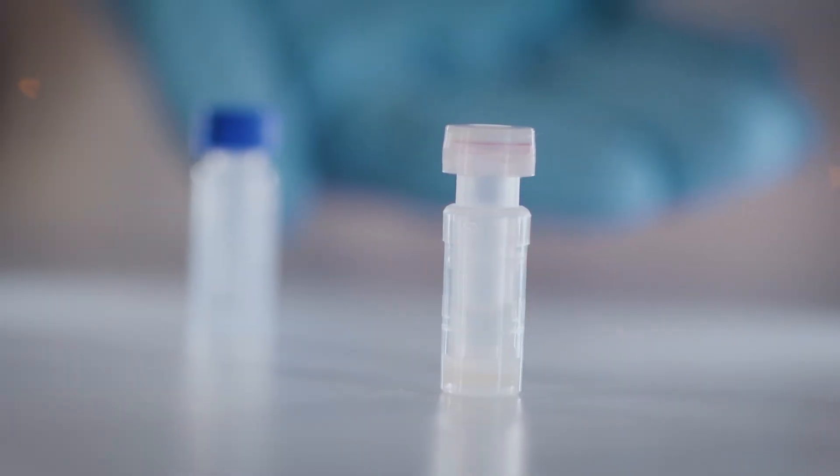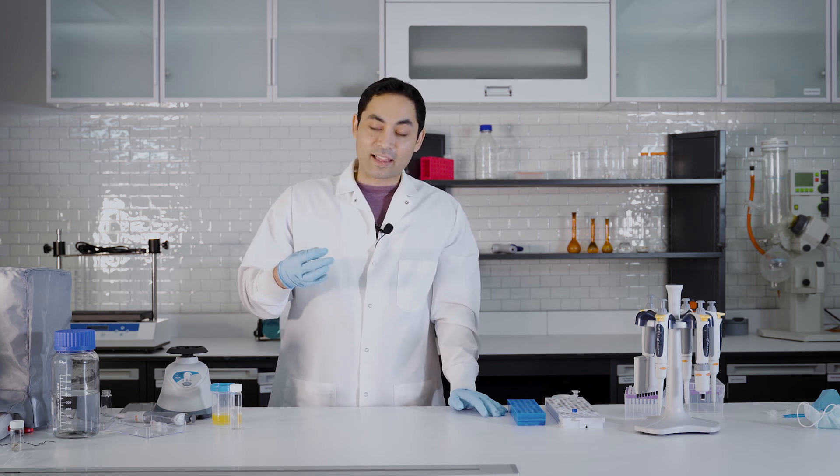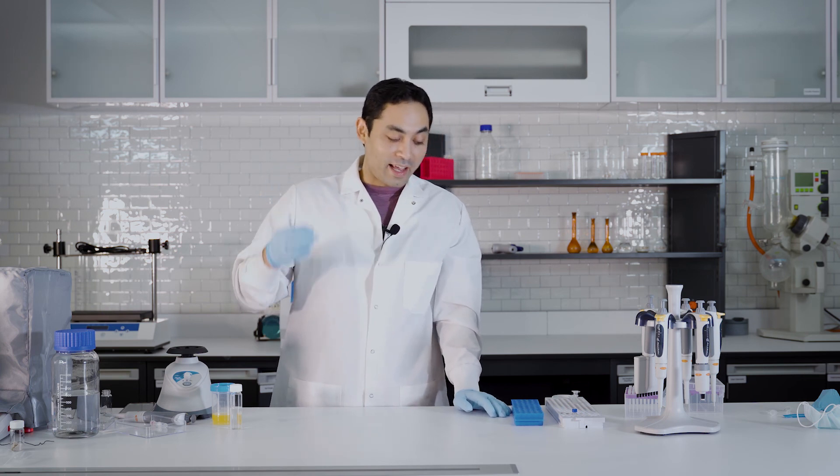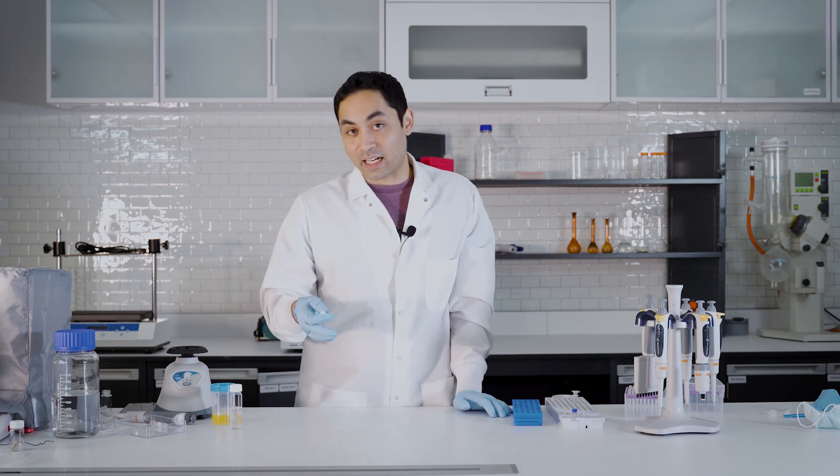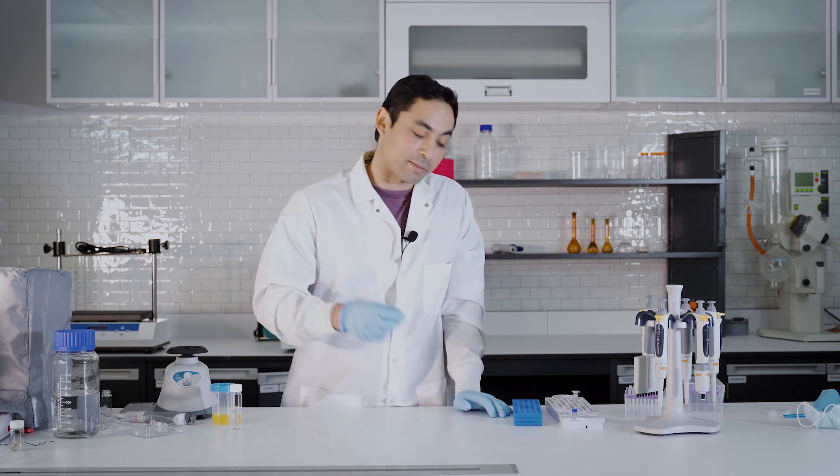But since this is all in one step you can still do it. Get the sample precipitated. You can get the sample filtered. And it's even cleaner. It's even easier. And this is ready to go into your LC or mass spec.